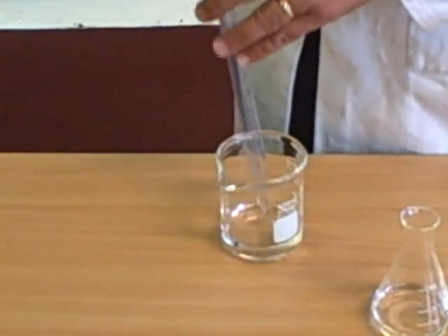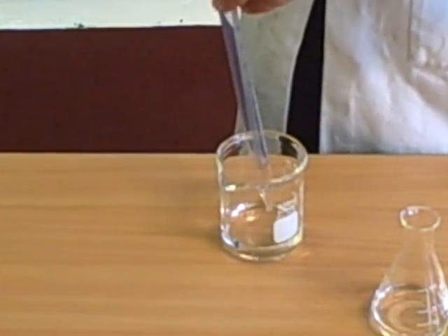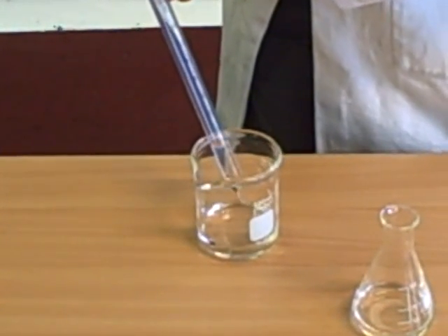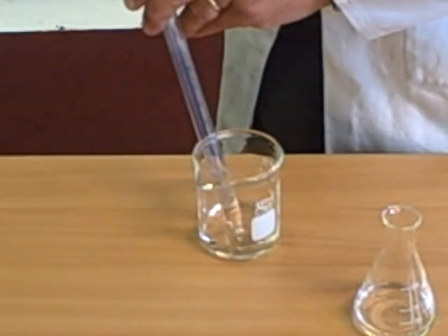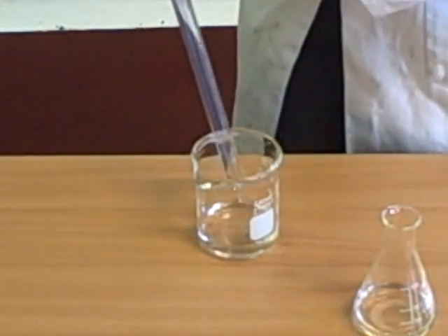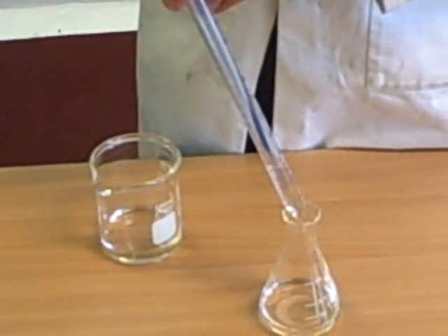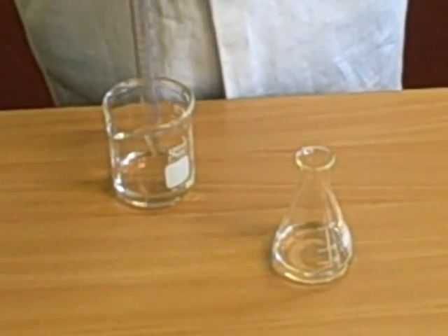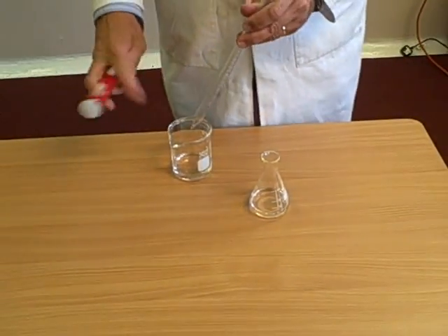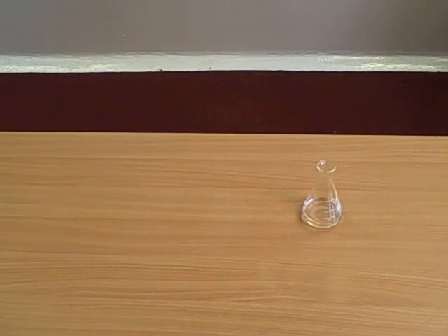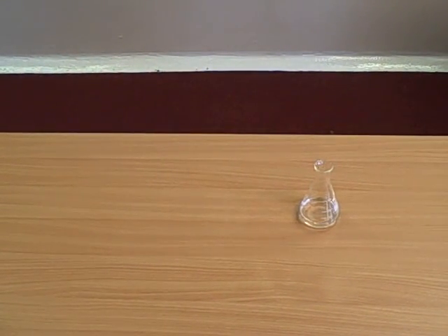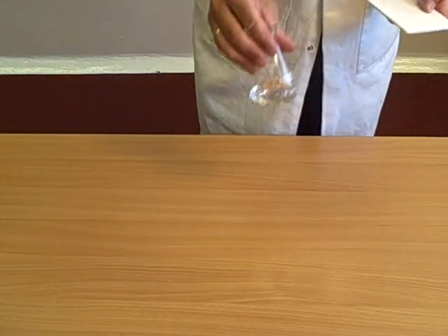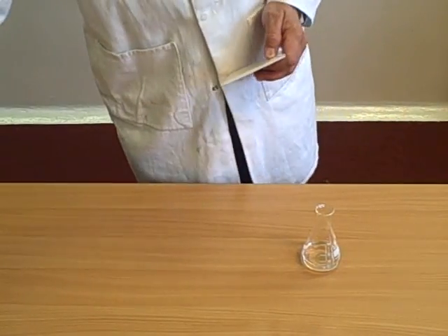So I need an extra 2 mils. So I go to 23, and I add 2 mils. You're going to do it a lot more accurately than I just have there. So, we take this to one side, and we take out a white tile. So I have, in here, 25 mils of sodium hydroxide.